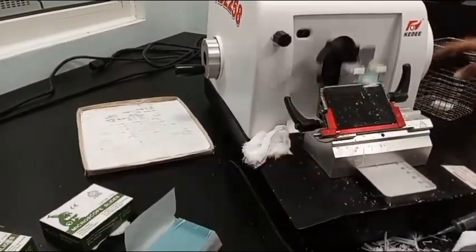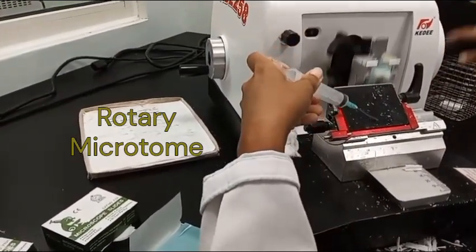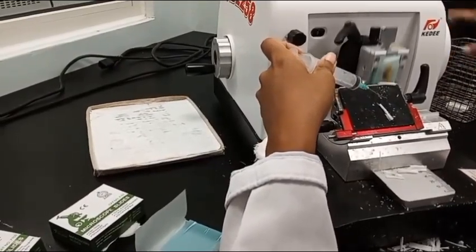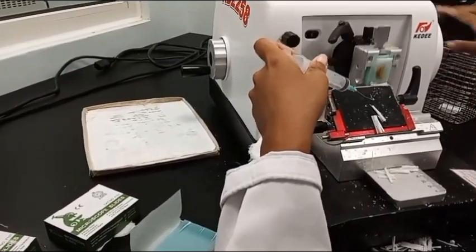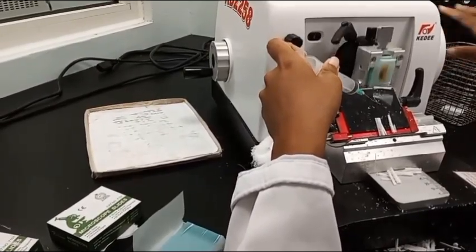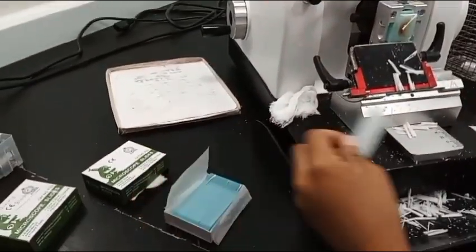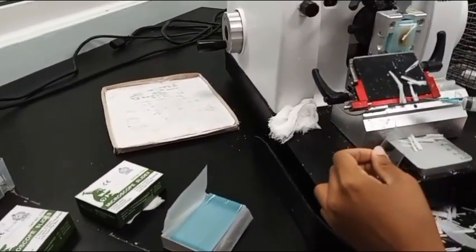Sectioning or microtomy. Sectioning is done to obtain a uniform thin section of tissue that is 3 to 4 micrometers in thickness without changing the architecture of the tissue. The microtome is the instrument used for tissue sectioning. Microtomy comprises trimming and sectioning. Trimming is the process where excess wax on the block is removed in order to expose the entire surface of the tissue. Sectioning is done to obtain a thin slice of tissue ranging from 3 to 5 micrometers in thickness.